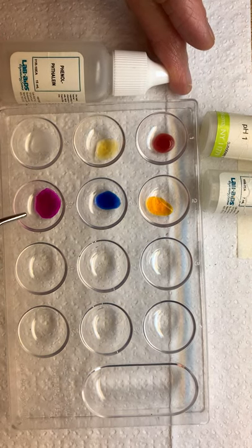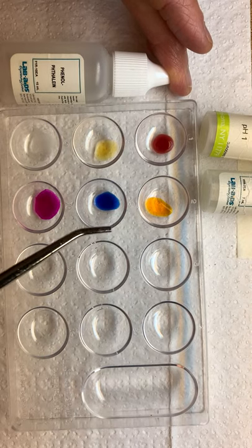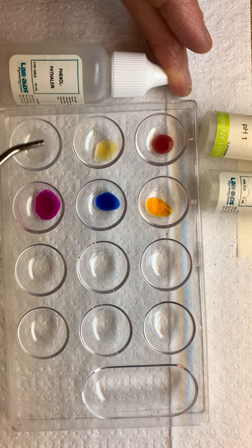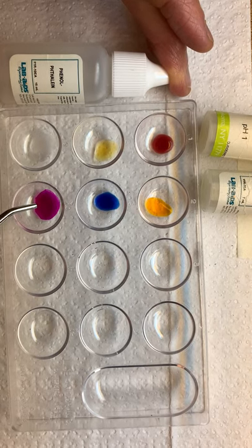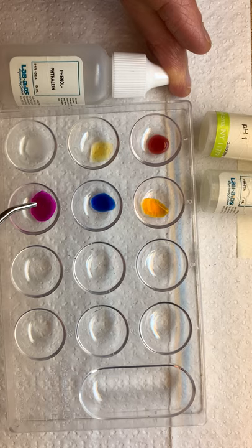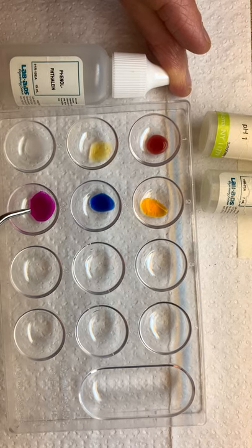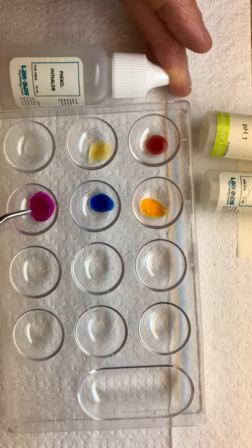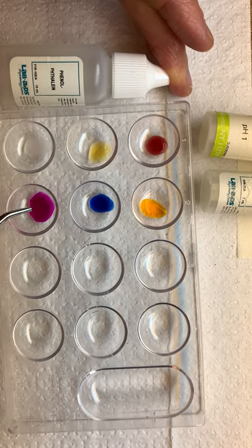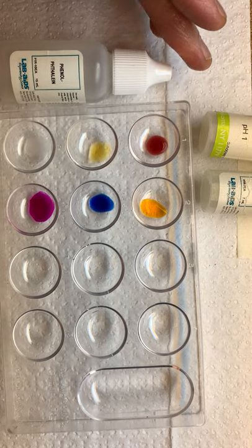What color did phenolphthalein change to in the presence of pH 13, which is a base? Phenolphthalein in pH 13 changes to magenta or hot pink. So phenolphthalein did change color in pH 13, which is a base — it changed to magenta or hot pink.